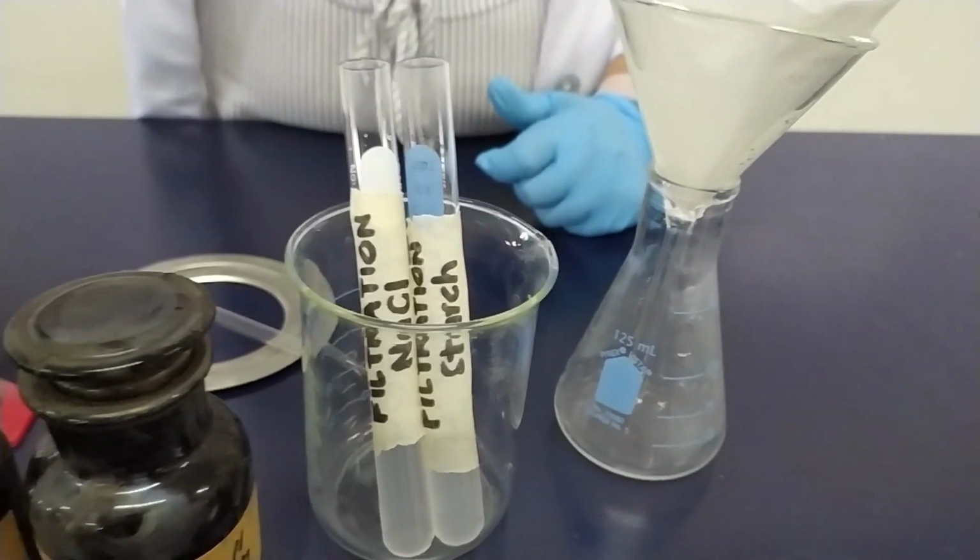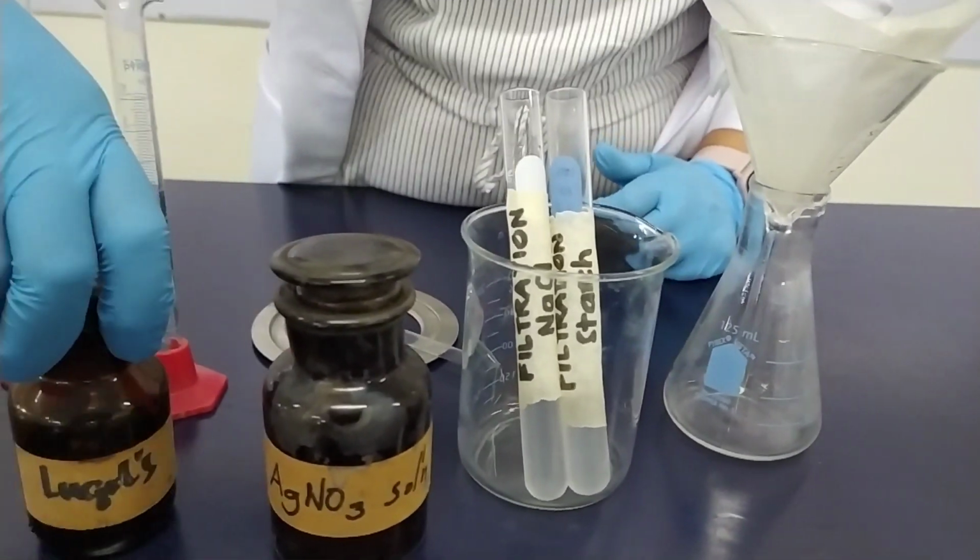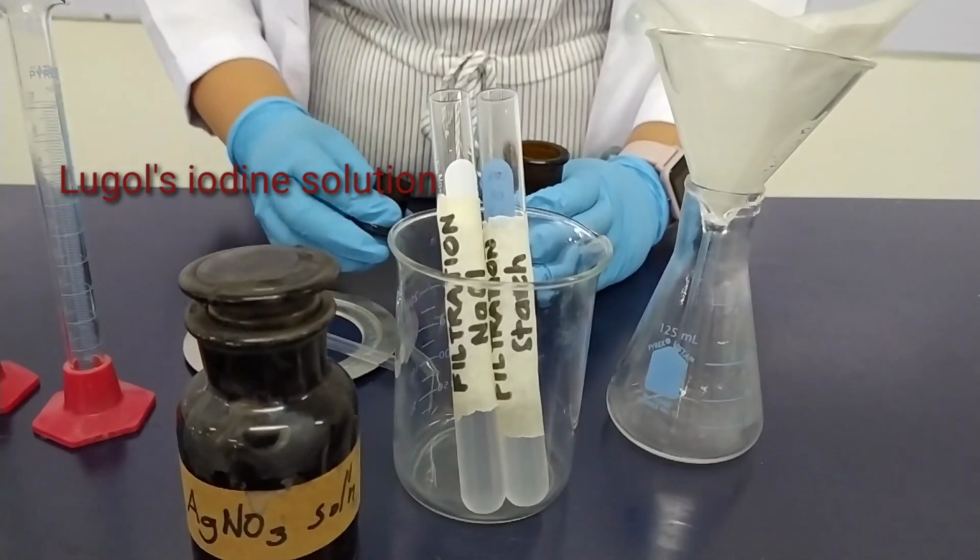To test for starch, add 10 drops of Lugol's iodine solution.